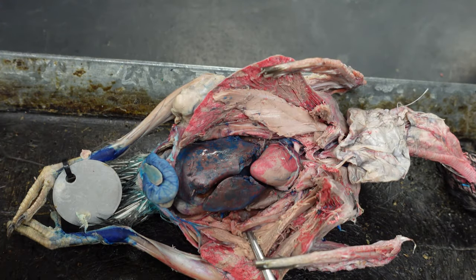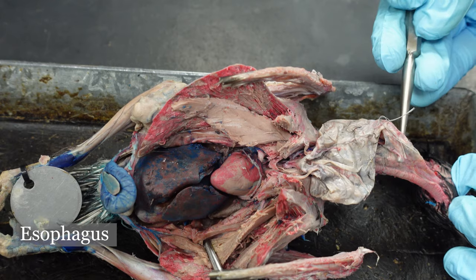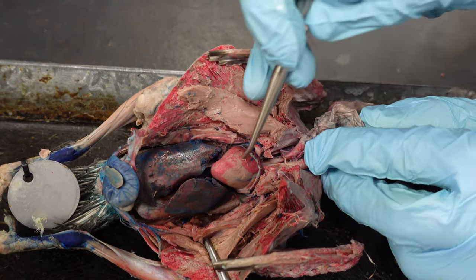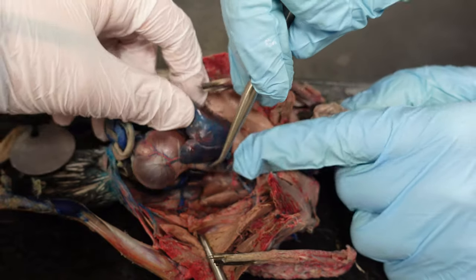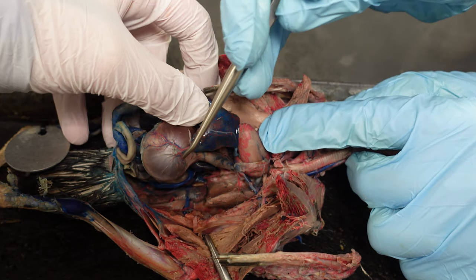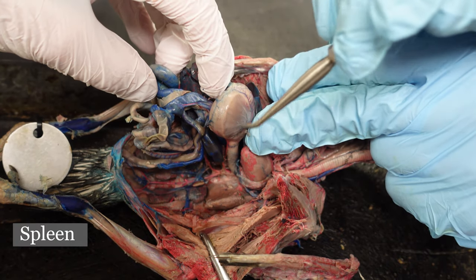Now we're going to move down to the abdominal area. But before we do that, I want to point out the esophagus, which has this outpocketing of the crop. We follow that esophagus down — it's going to dive beneath our heart. And we can lift this up. That esophagus empties into the proventriculus, which is a slight swelling. The gizzard is a very hard structure. We also have the spleen lying dorsal to that gizzard.